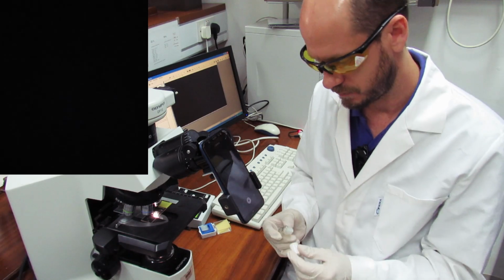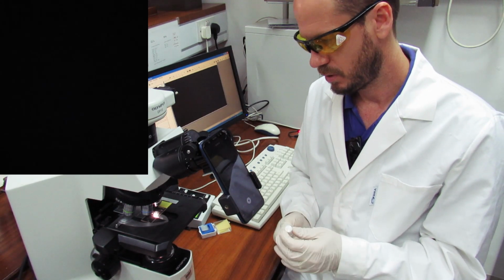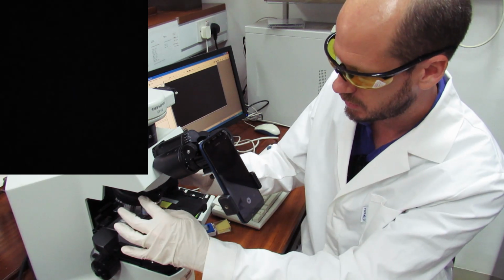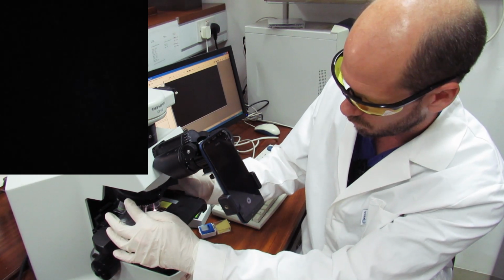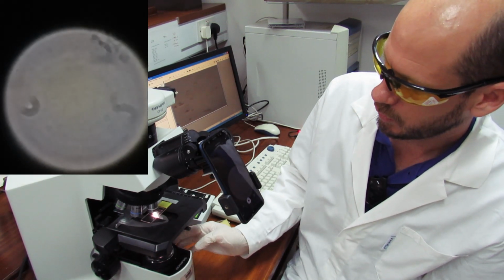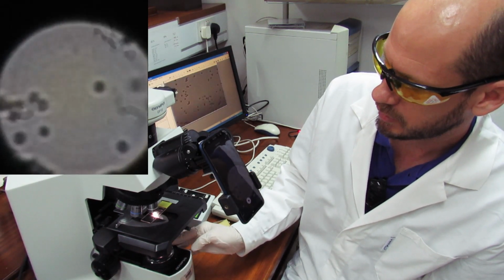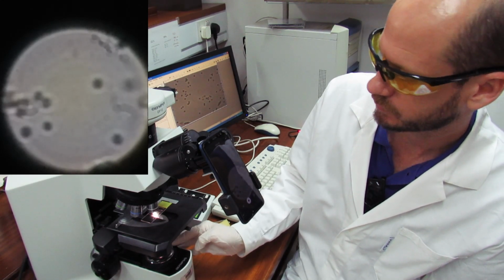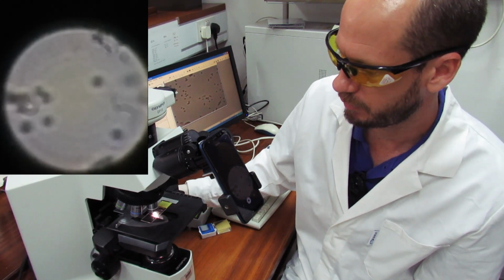All right. Add a small drop of this here, and we finish sliding this to the 100 magnification lens. And then we can increase a little bit the light if it's possible. Okay. Increase a little bit the light and go for the fine knob for focusing.